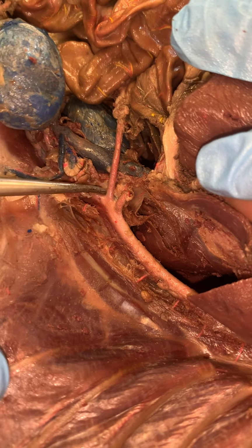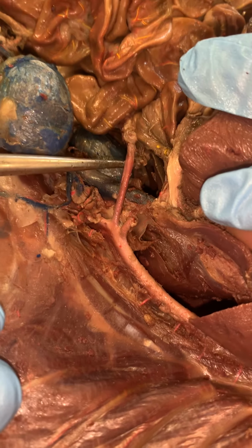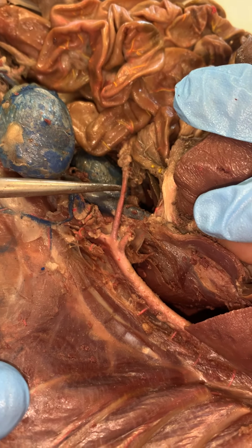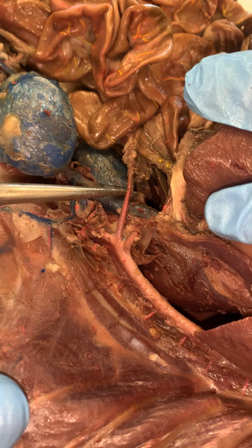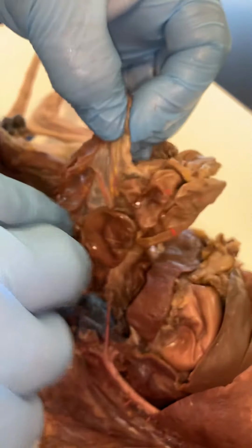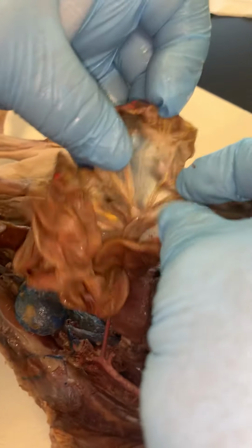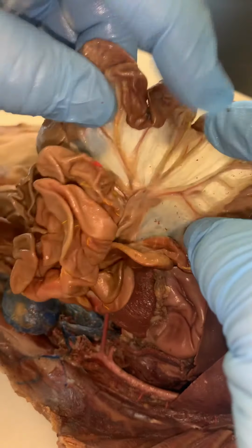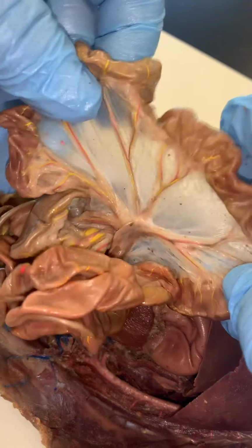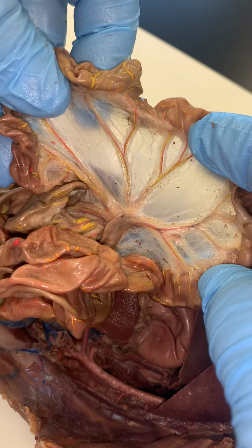The next vessel down here is this large superior mesenteric. And this will be going to the small intestines, the ascending, and the transverse colon, this one here. And what's kind of cool to look at, if we hold up the intestine and look at the mesenteries, we can see how they branch and form this arcade of mesenteric vessels. And that's kind of cool to look at. All right.